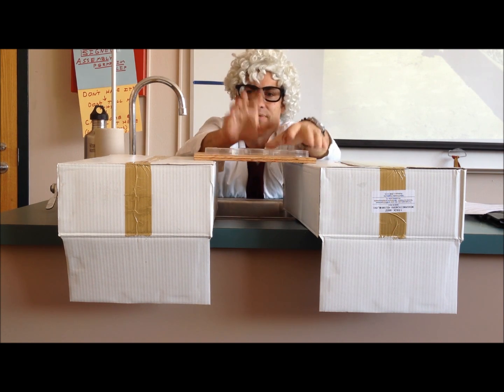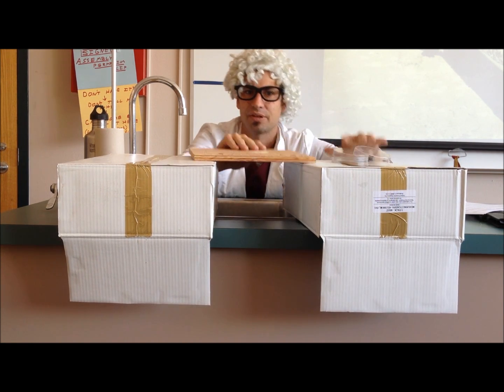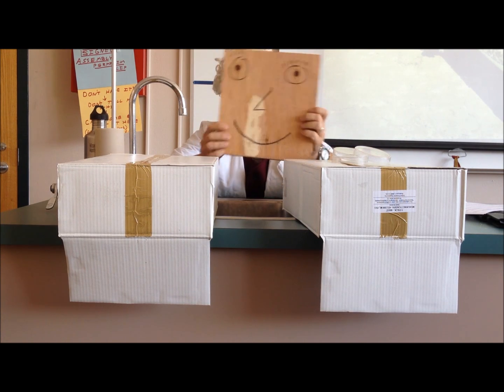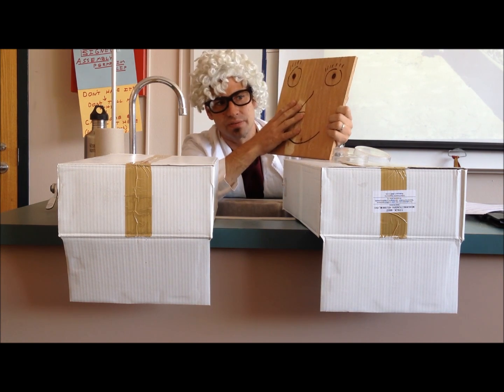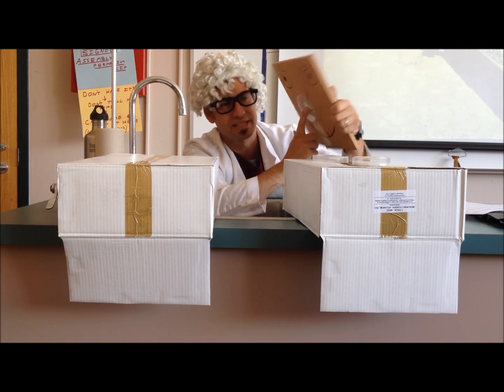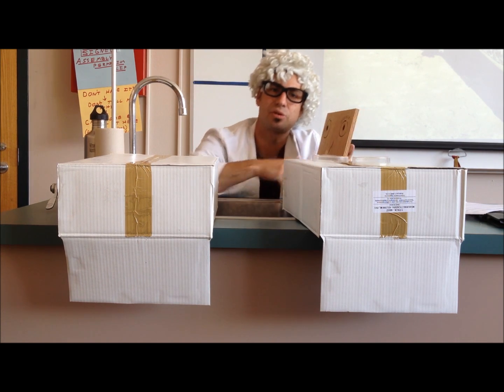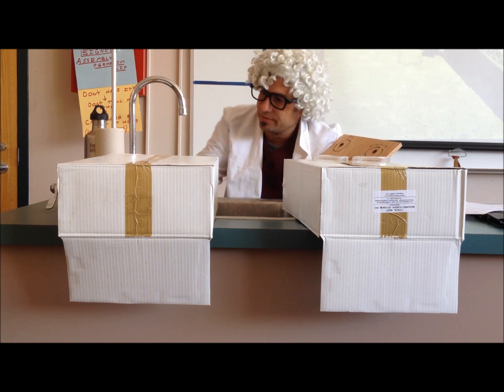And then we will stop and you can write down why you think this happens — the inference. So, what's my job today? We're going to take this guy right here and try to give him a better nose. Like the Petri dish here — put it on here like this. We will try. Write down your observations.